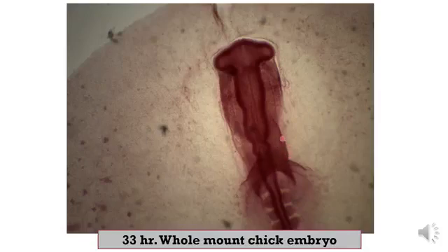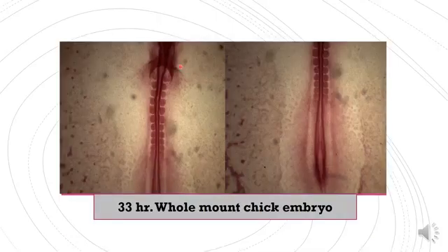And this is the heart tube, formed from anterior to posterior by the bulbus cordis, ventricle, atrium, and two horns of the sinus venosus. And this is the notochord. And this is the somite.